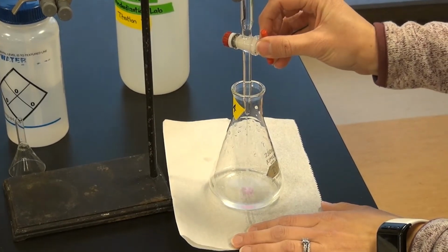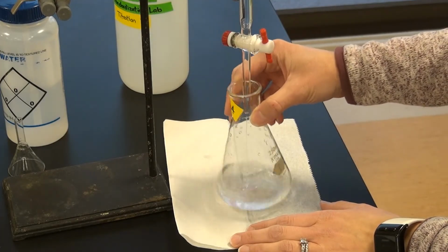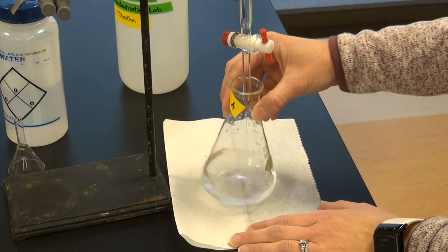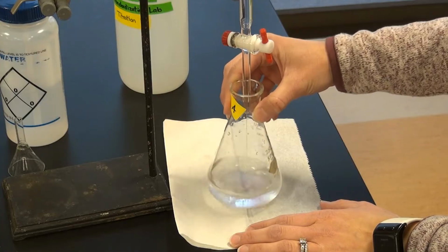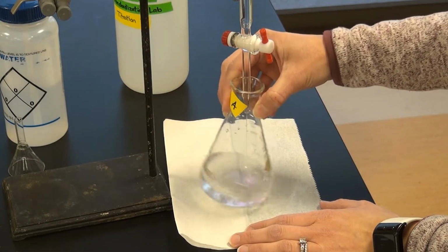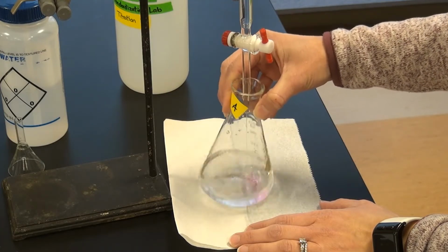Start that. Okay, we're approaching 5 mils added.